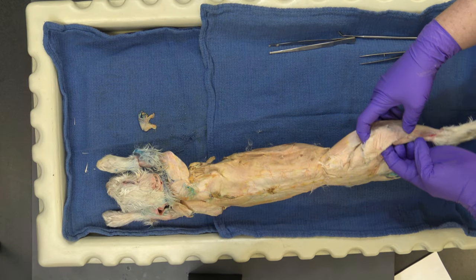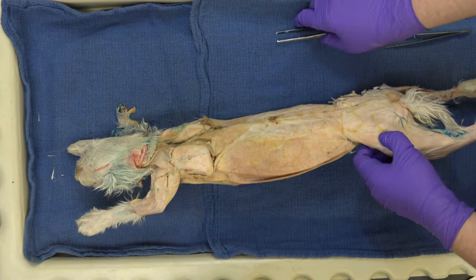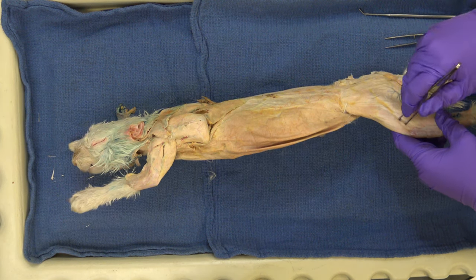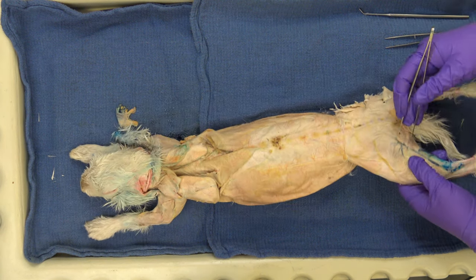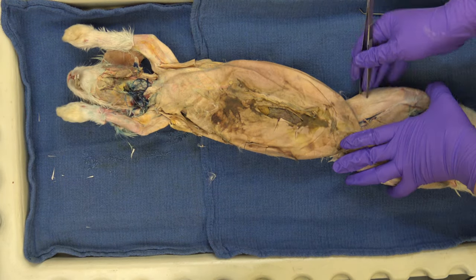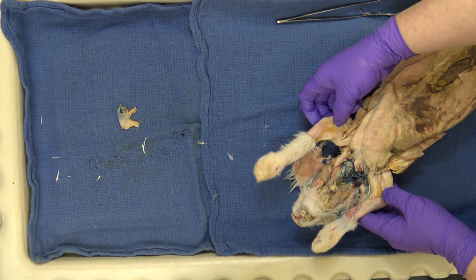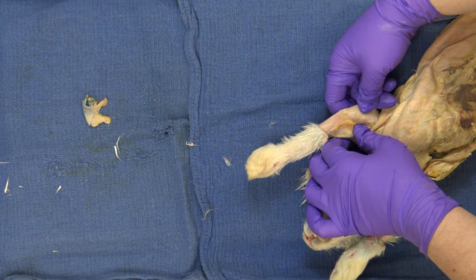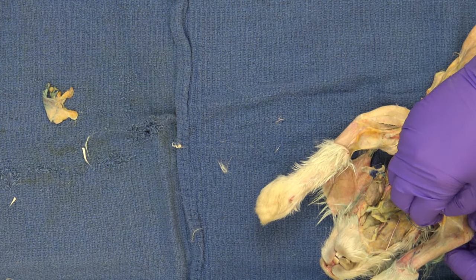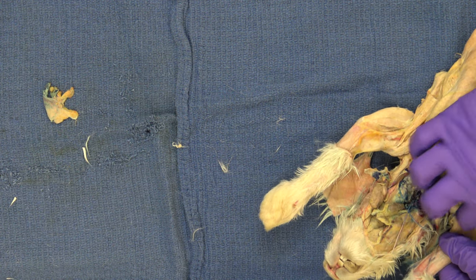Here in this leg, see all of these are separate because when you just take off the skin, you still have this tight fascia, this connective tissue that is wrapped around everything. It really makes it hard to tell how many muscles you have in areas. It's a little easier to just parse it apart with your hand, break through this to separate them out, but it's still really hard to see the individual muscles without that preparation.